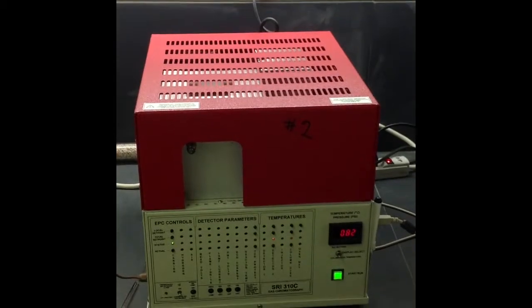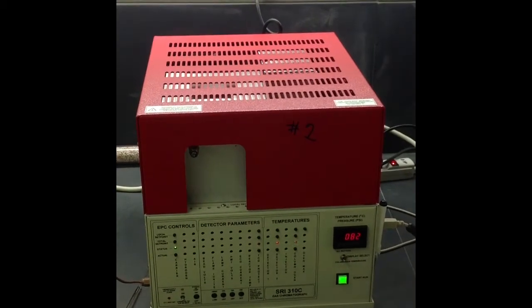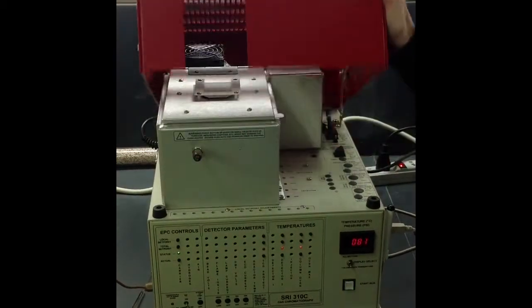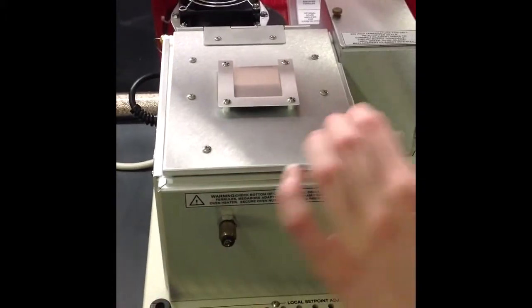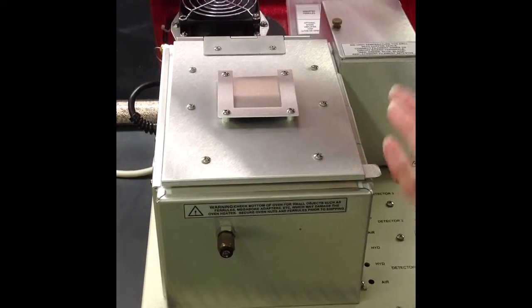Here I'm going to tell you about the instrument. So this is the GC. If I lift this up right here, you can see the oven, and we have our needle port. And the oven actually contains the column.